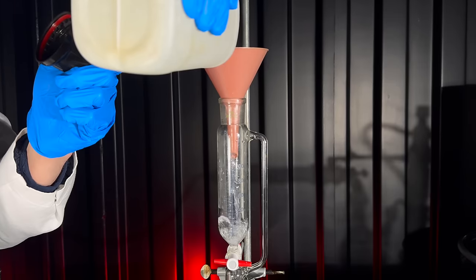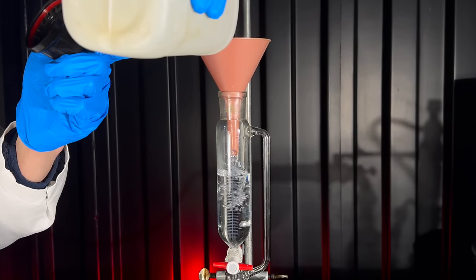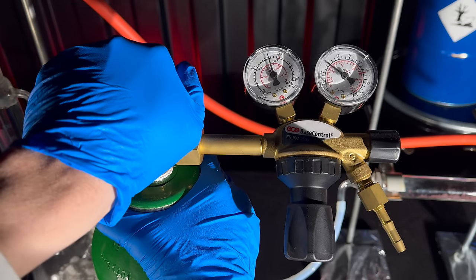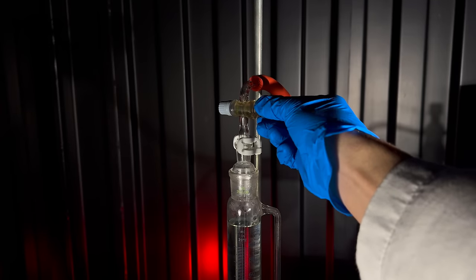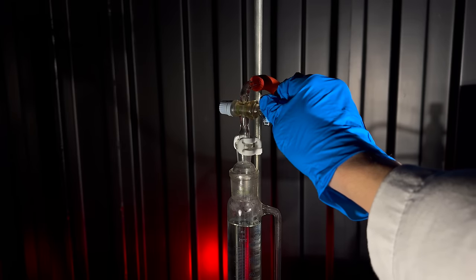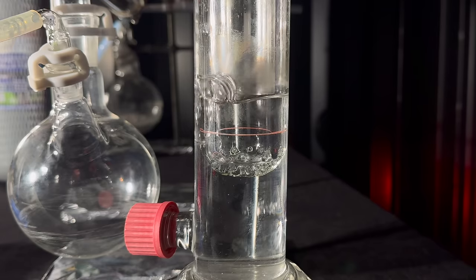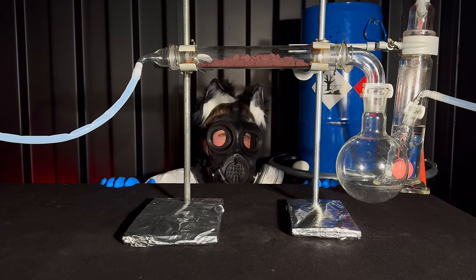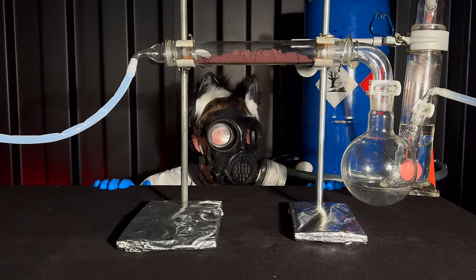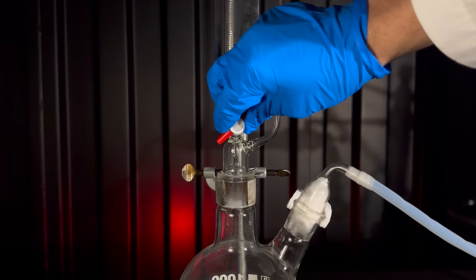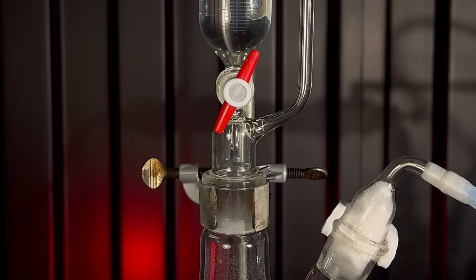I successfully circumvented one washing bottle, but can't do without another one. As long as I am using an excess of chlorine, whatever is not consumed by the reaction needs to be neutralized somehow. A washing bottle with sodium hydroxide solution is going to absorb most of it. After making sure that the valve of the addition funnel was closed, I added 100 milliliters. 210 milliliters will be required in total. I flushed the apparatus with argon to get rid of any air. Now that I greased all the joints, let me generate funny yellow and highly toxic chlorine gas.